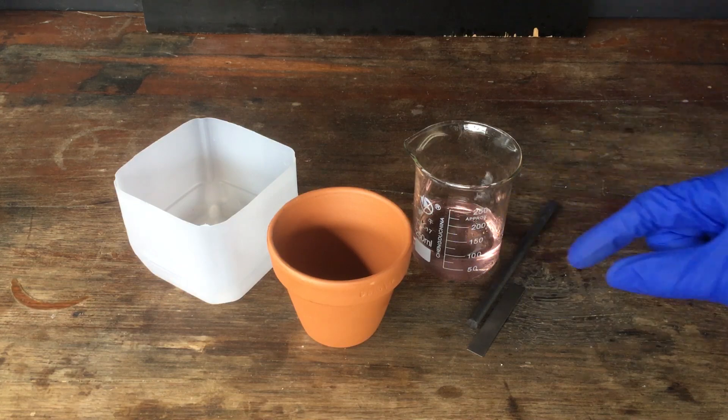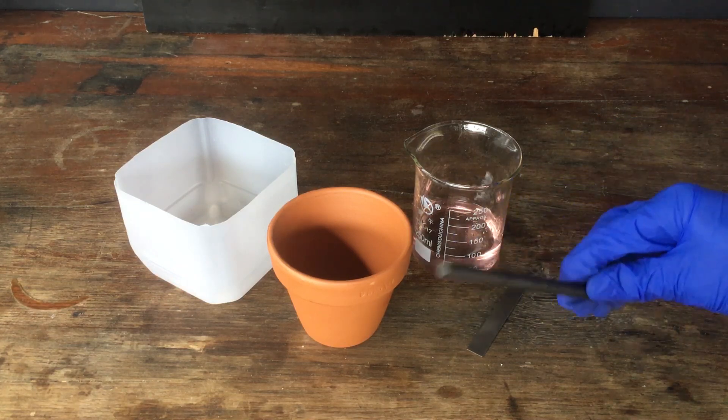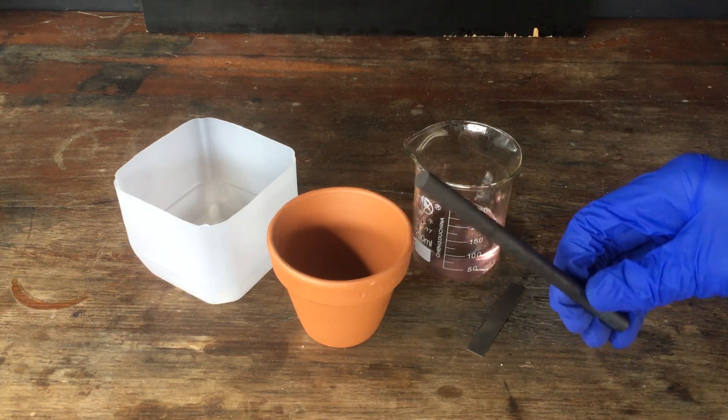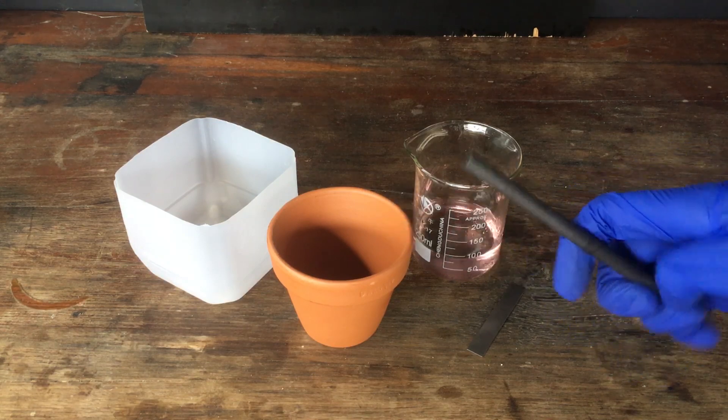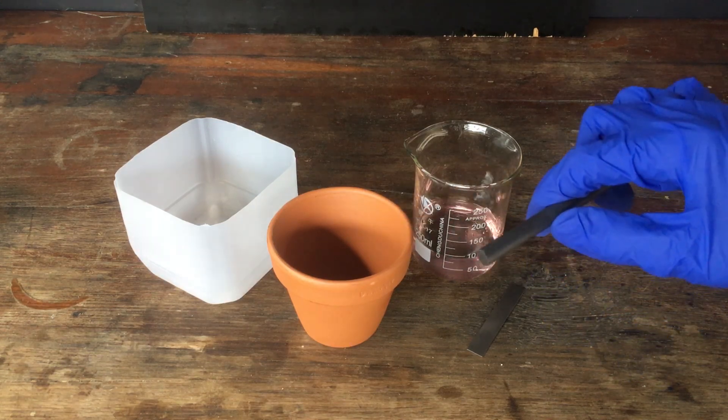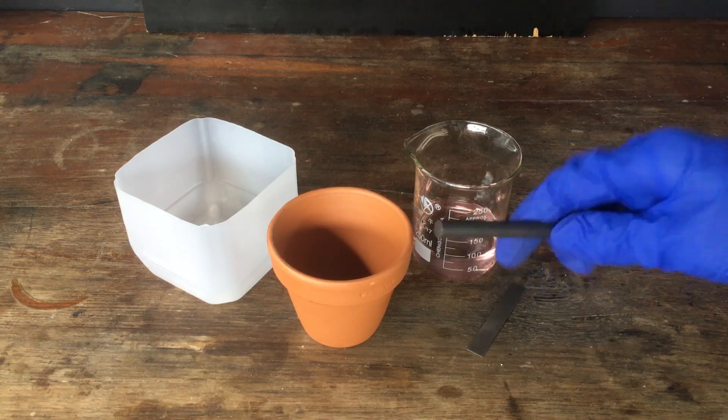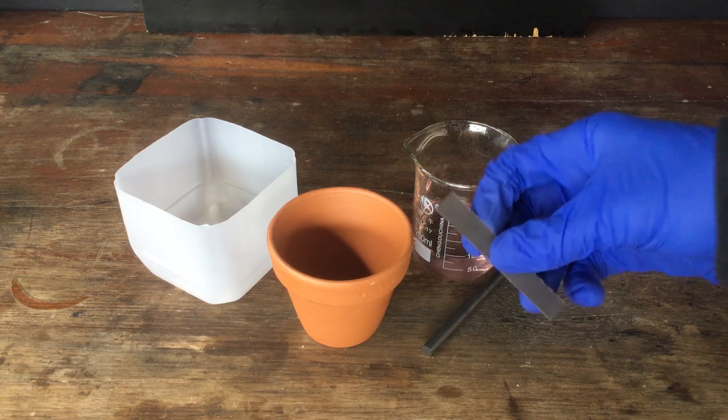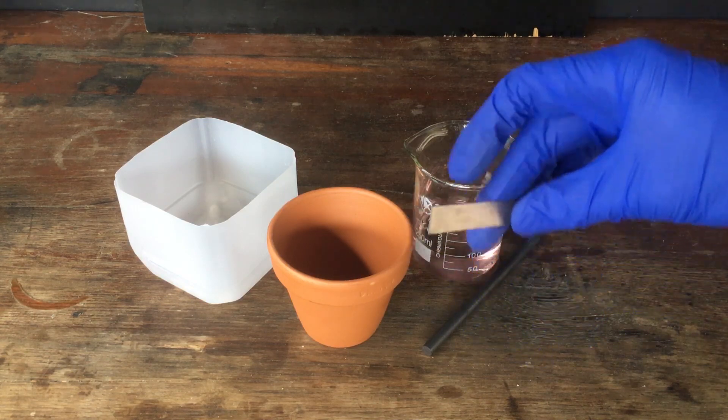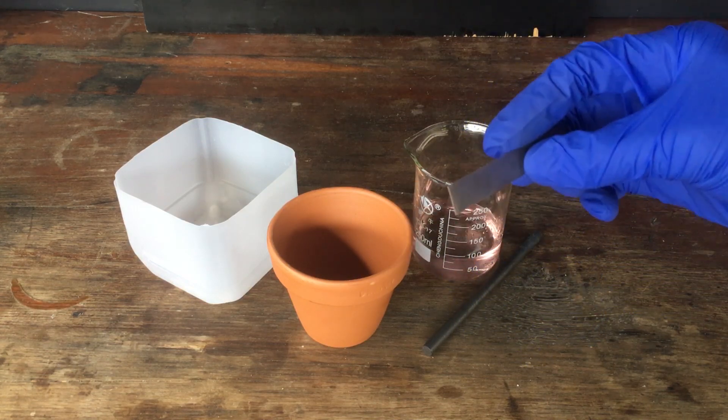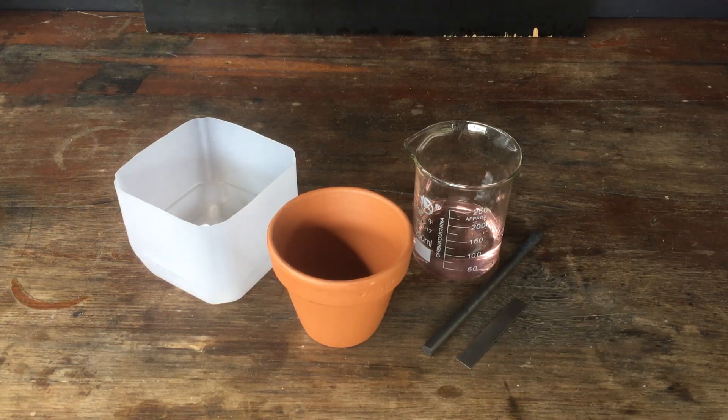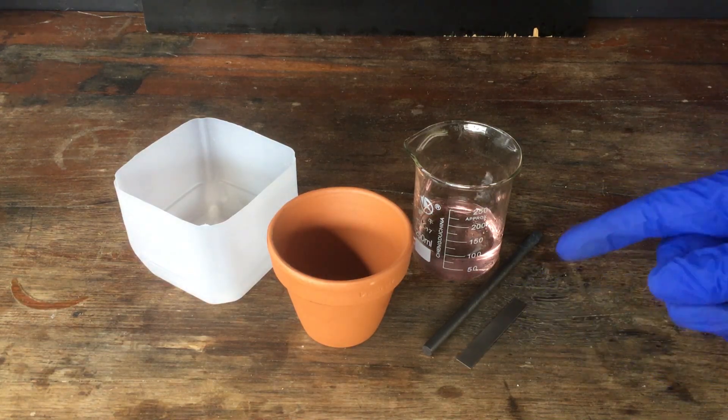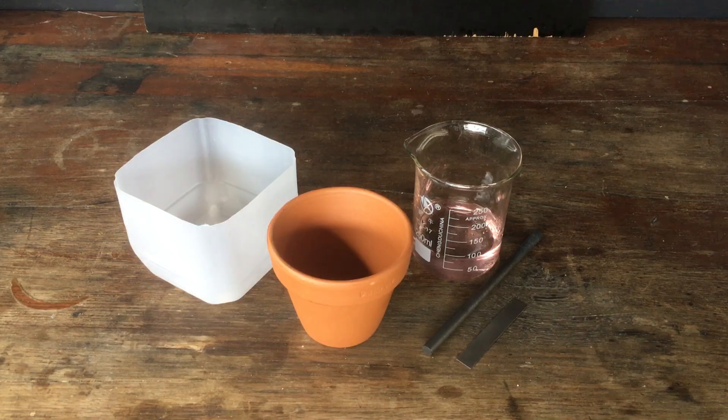I've tried plating manganese onto graphite before. That never seemed to work really well. It made some kind of insulating layer between the graphite and the manganese, which prevented it from being usable. So I'm hoping that if we plate it onto titanium, it might make an effective manganese electrode. Anyway, I will set up the cell and we will get straight to making our manganese.